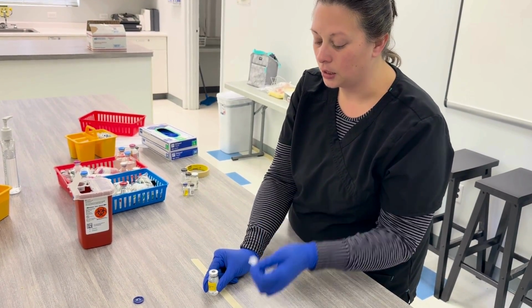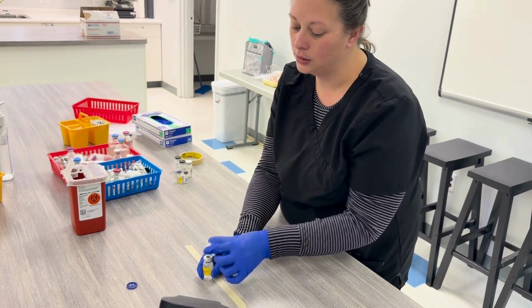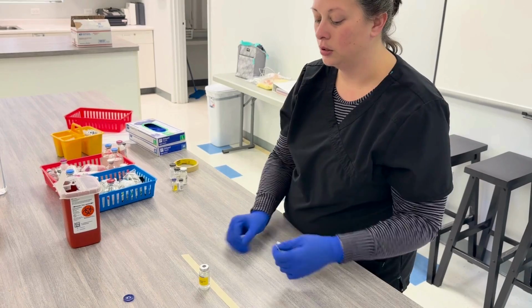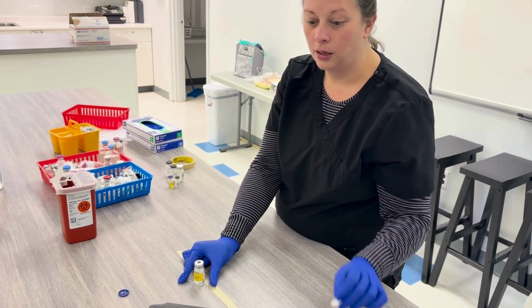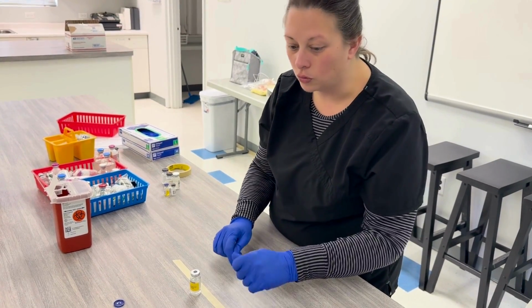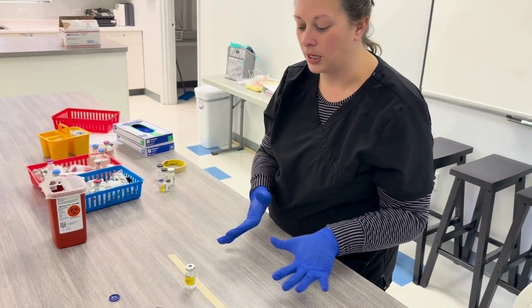I take it across the top firmly, once, twice, done. So you notice I did it in the same direction, twice, done. Okay? No scrubbing, just one, two, done.